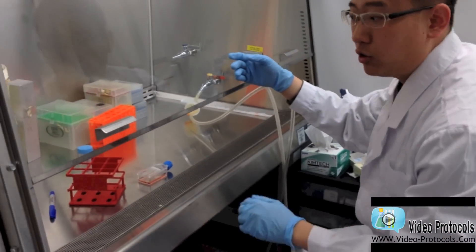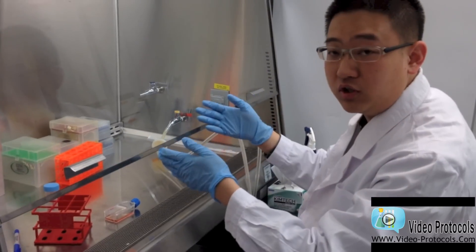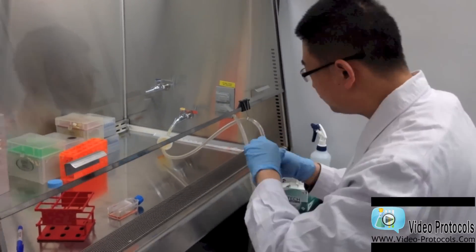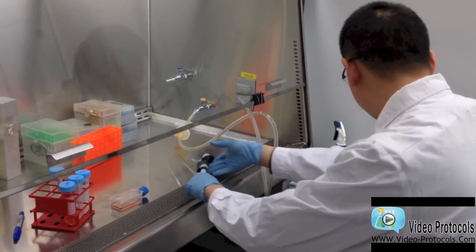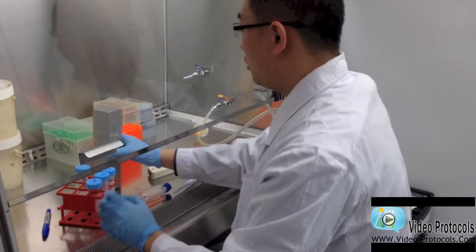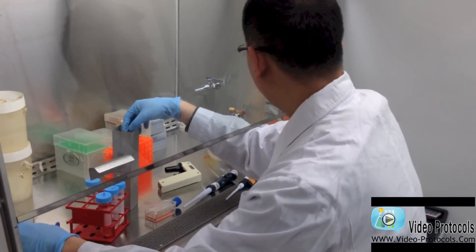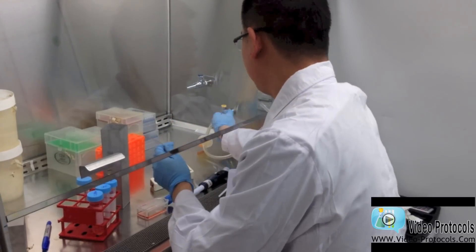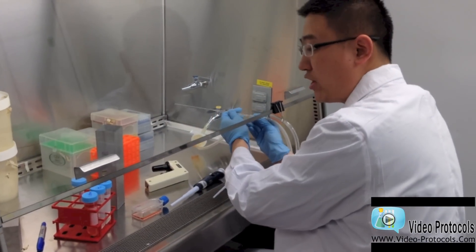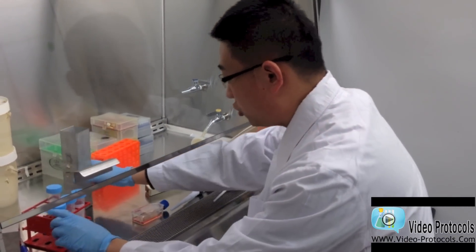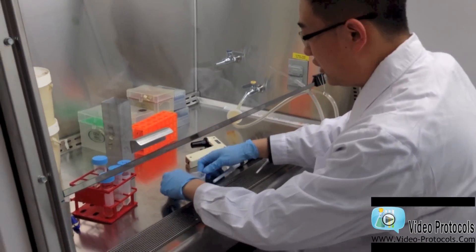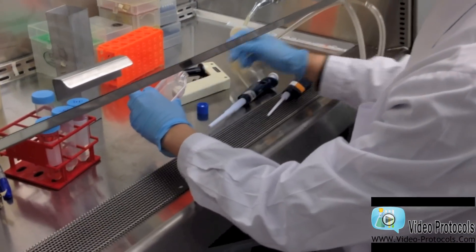This is the sterile hood. Anything that goes into the hood needs to be sterilized. We will first use this aspirator to aspirate the old media.